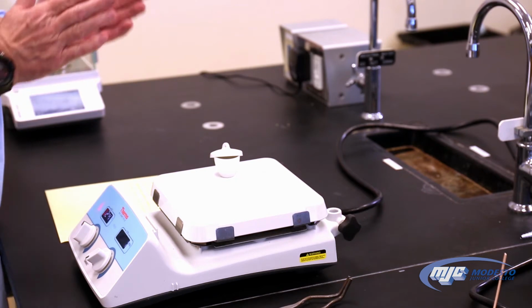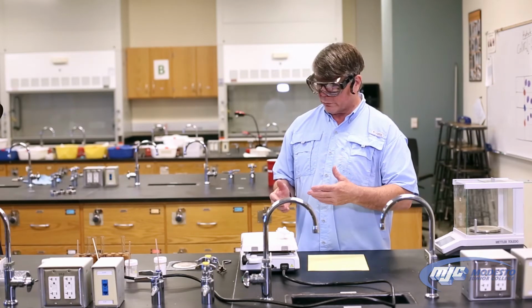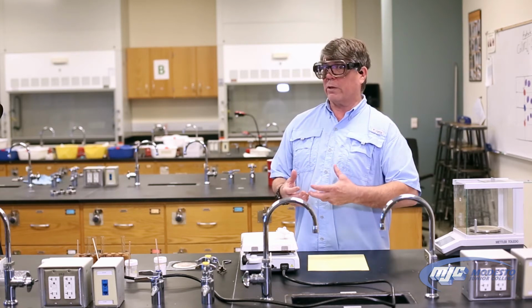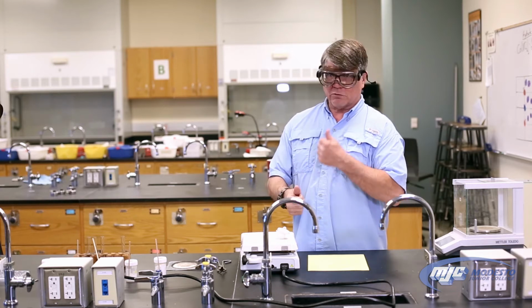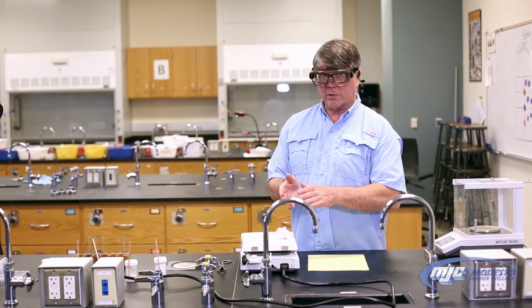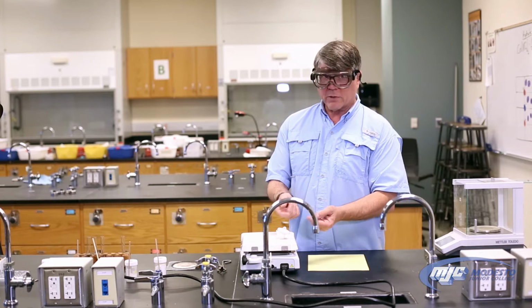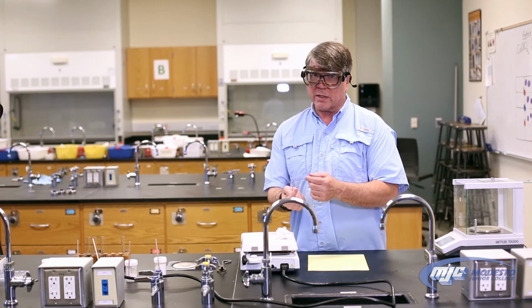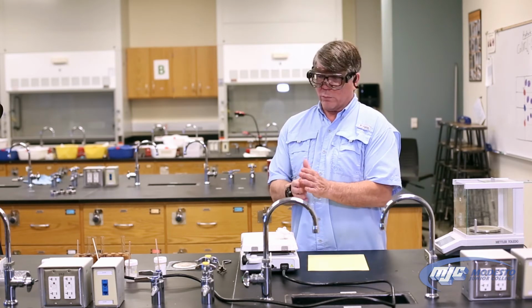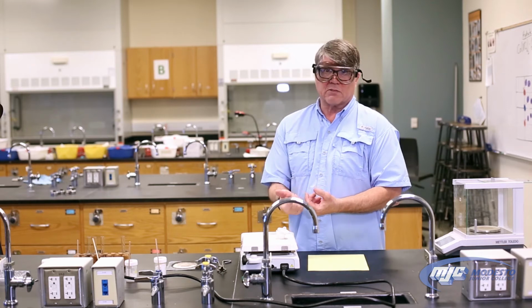Okay, so a couple things. It's on gentle heating now because with some of these hydrates, when you first start heating them up, as the water molecules start to leave, they leave really rapidly and they start bumping and shooting stuff out of the top of that. And we want to avoid that because we need to know how much everything weighs. That's also, by the way, the reason that we have this lid. If that does start happening, they'll hit the inside of that lid, stick to it, and because we weighed that lid with the empty crucible, we're going to weigh them all together at the end. We will include the mass of anything that did get stuck to the inside of the lid.